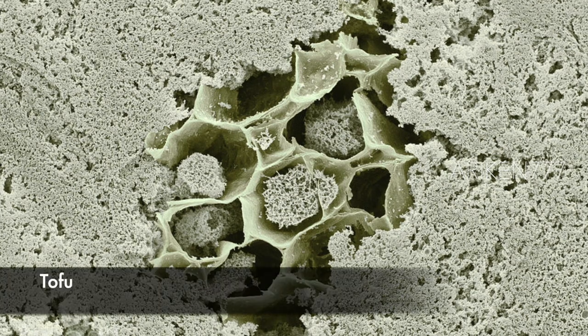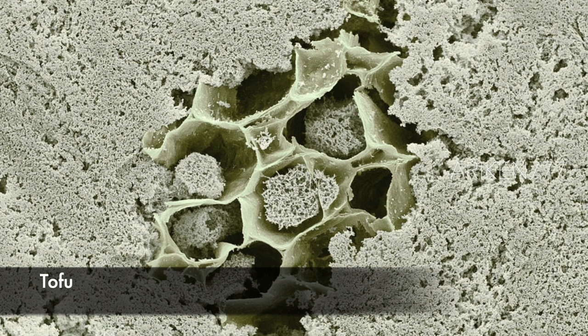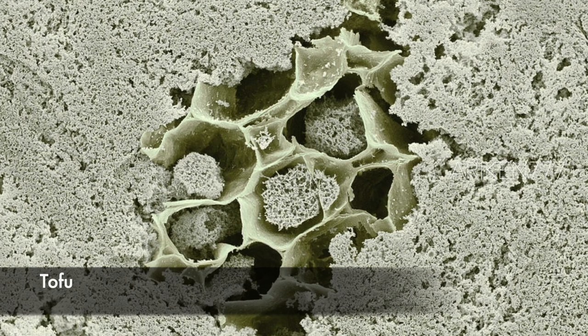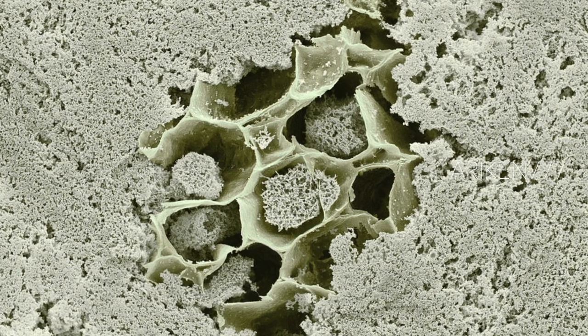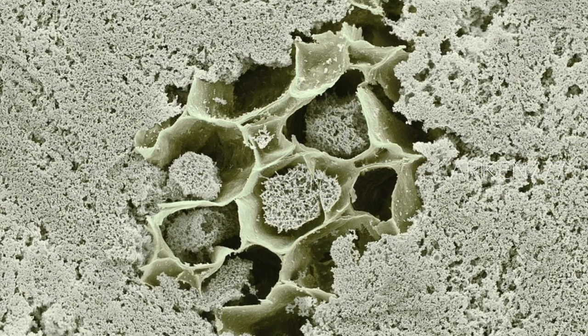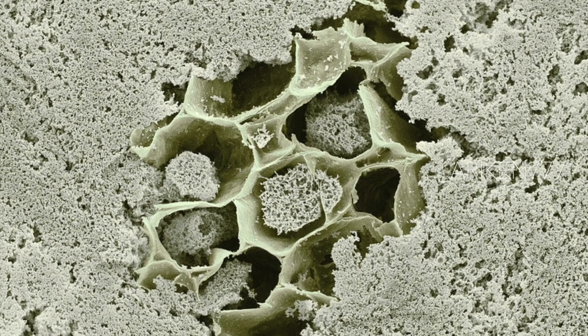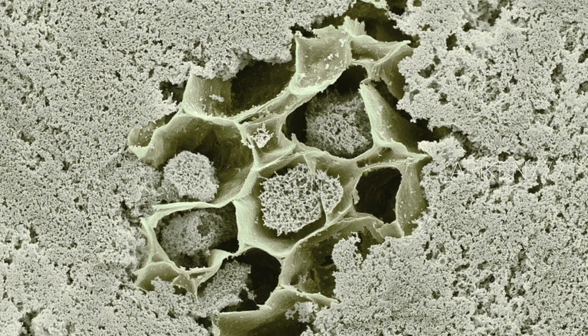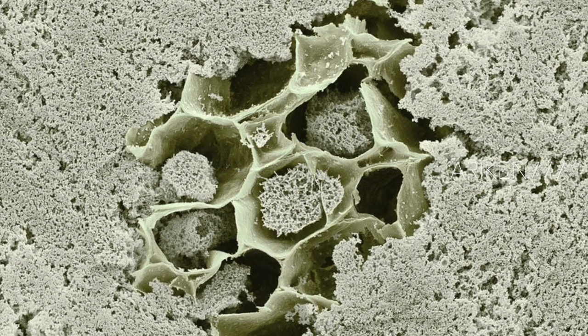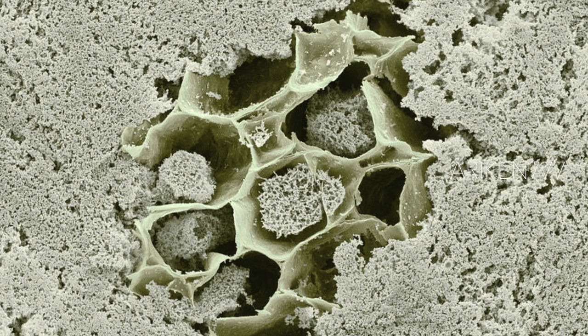This is tofu, showing the microstructure of coagulated soy milk proteins. A minor particle of the soybean consisting of cell walls filled within the tofu indicates that this is a product made from a plant source.